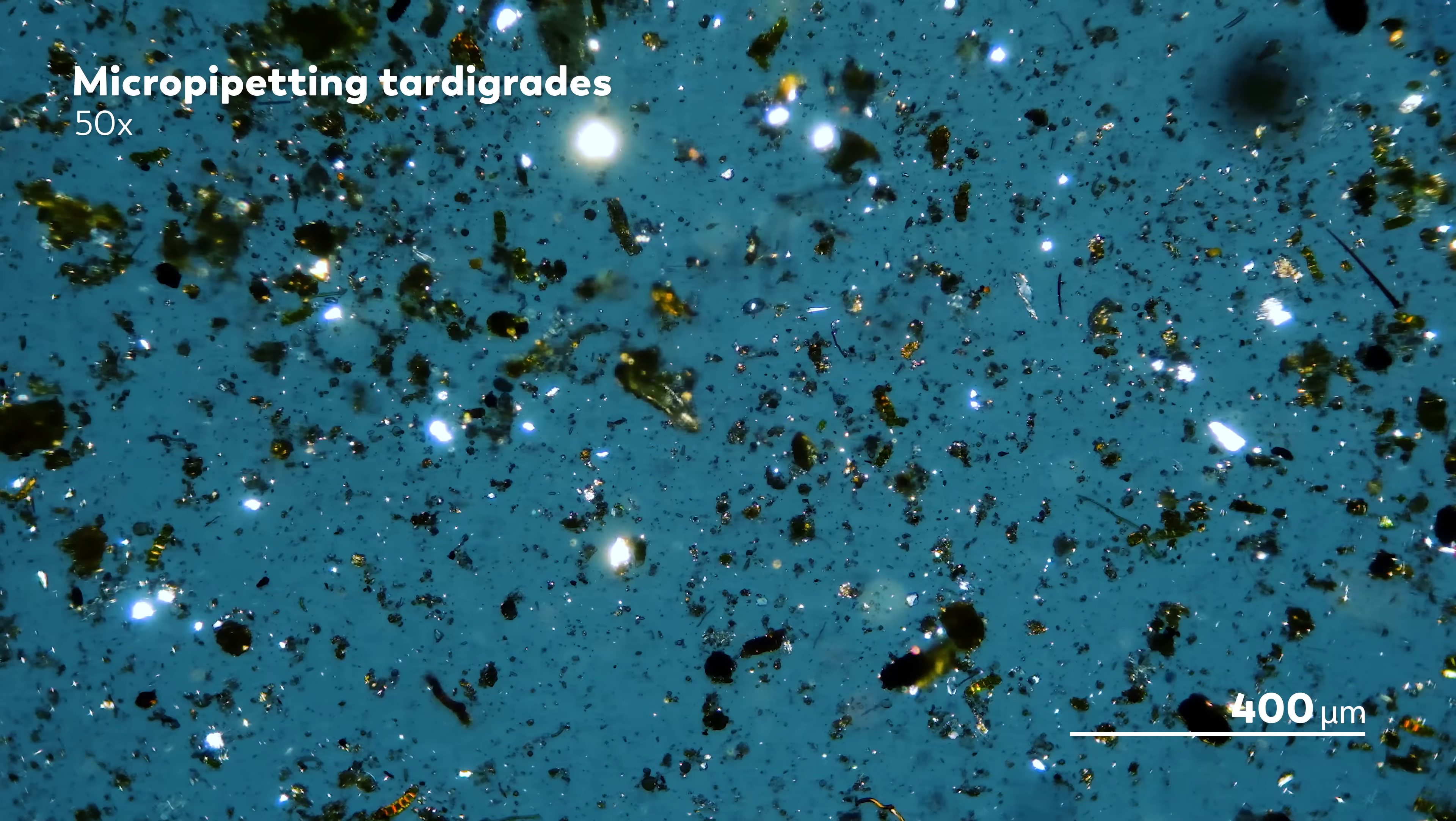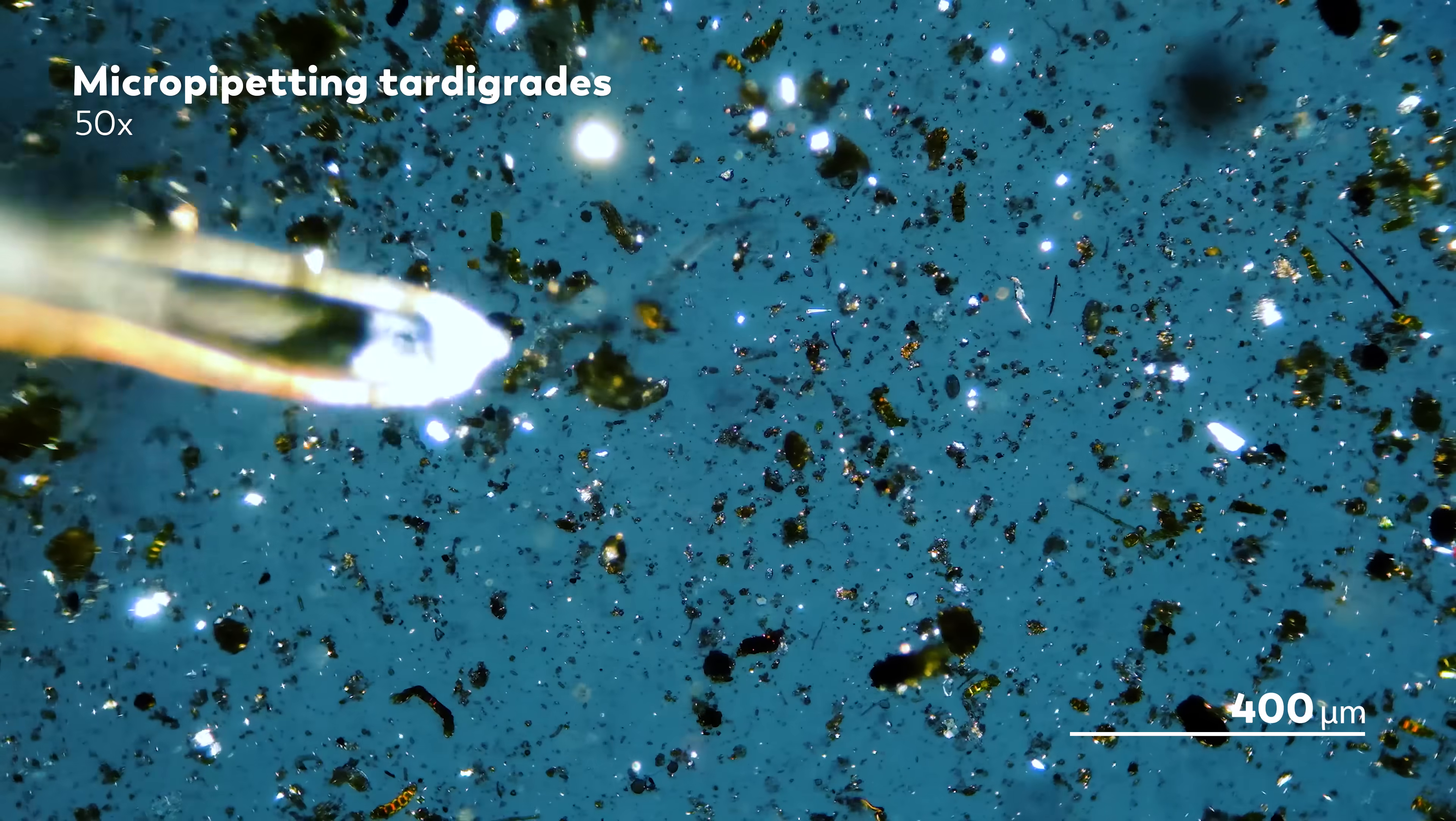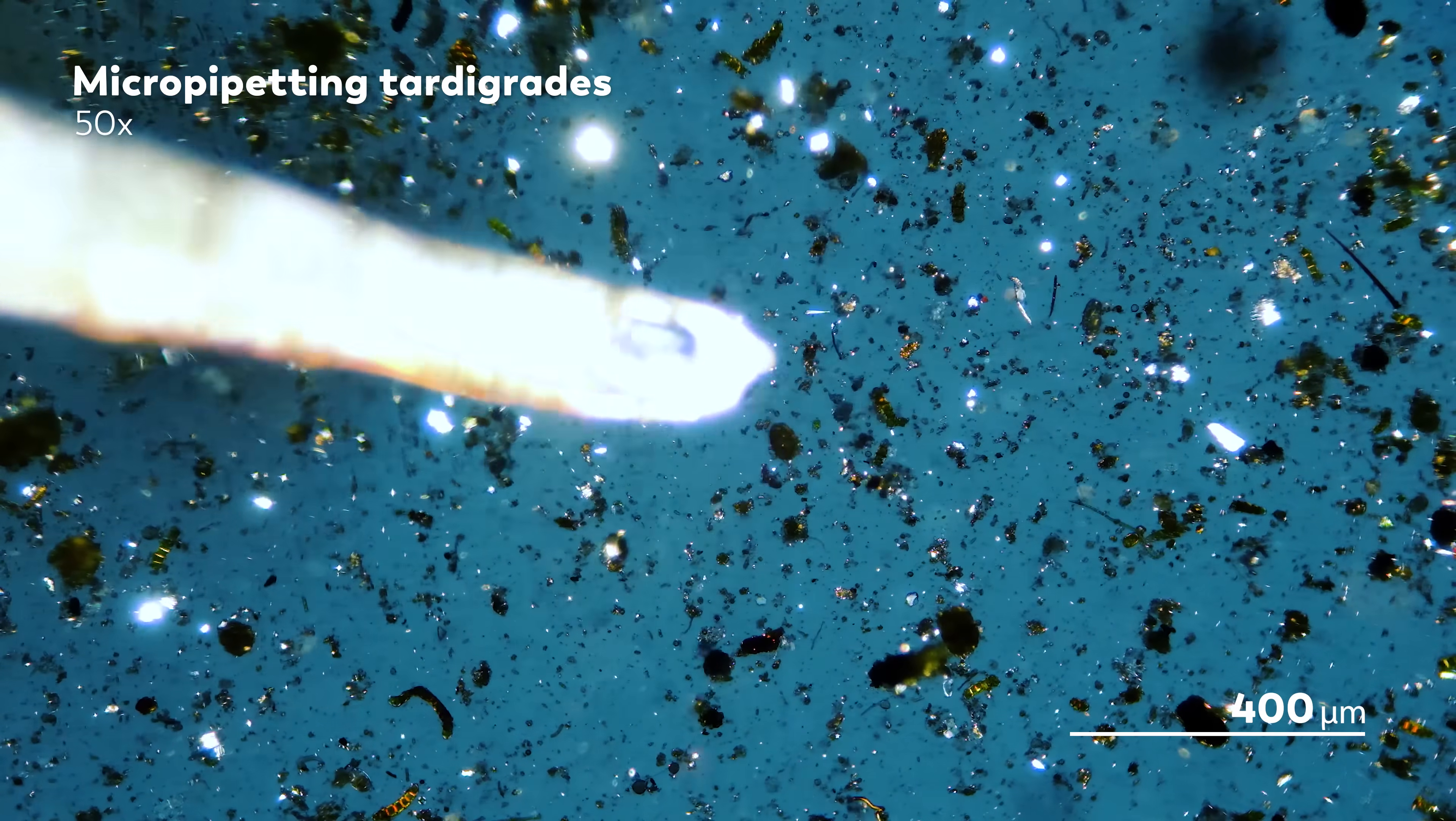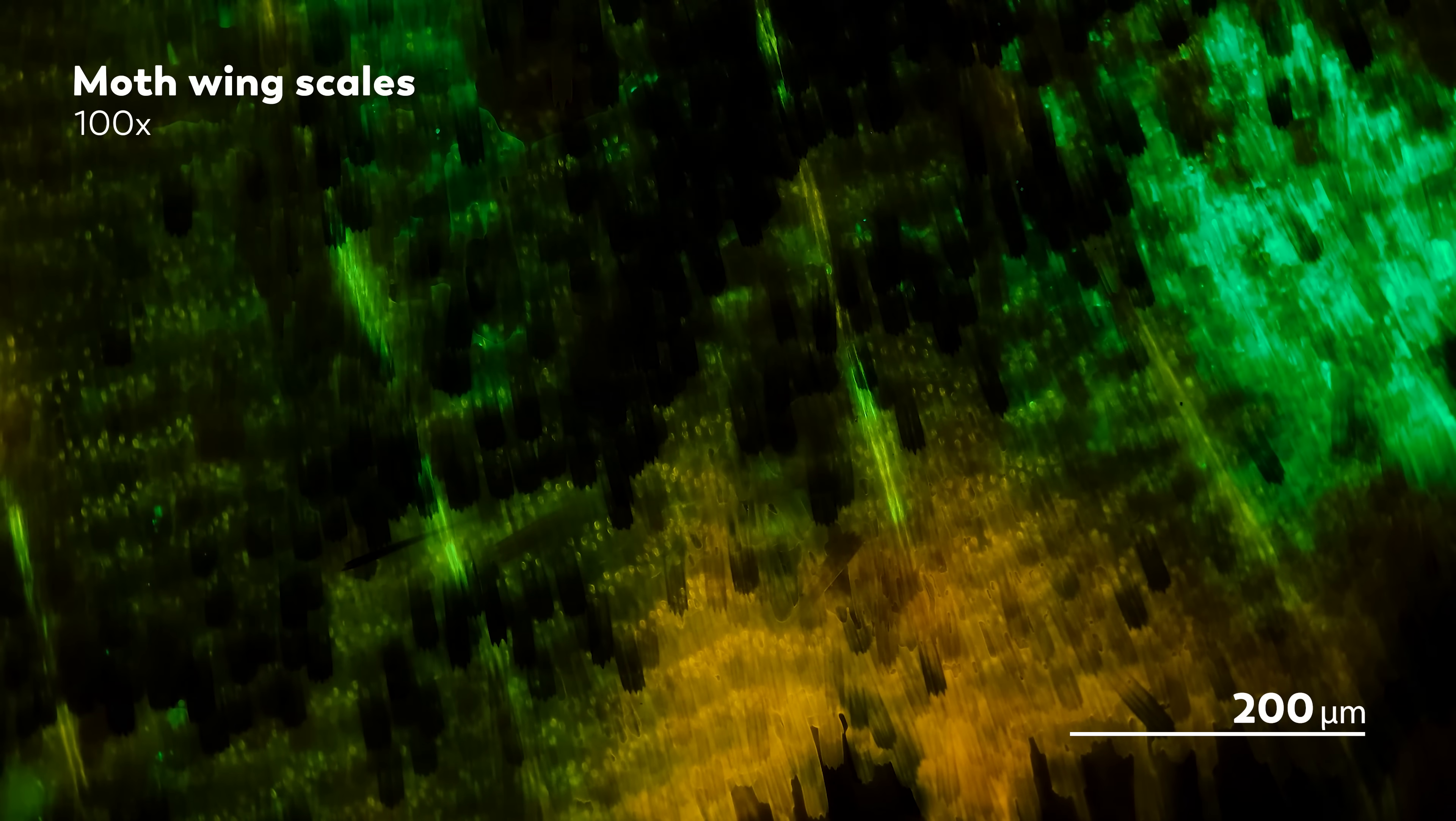James put a note on this script here that says, when I micropipet a tardigrade, I feel like I'm beaming them up to the mothership. And James' experiments continue.